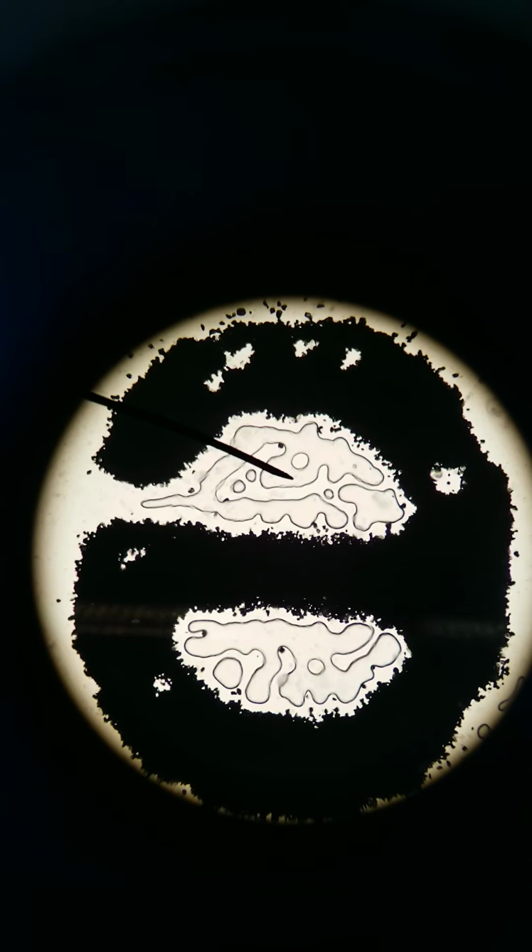To illustrate what it looks like at 400x total, I'm going to switch to the high power objective, the 40x objective. Here we are at 400x total magnification, and I'll change the focus a little bit. There we go. You can notice that it got a little bit darker. The higher the magnification that you go, the darker it gets. So you'll want to adjust the lighting a tiny bit. Play with the illumination knob, play with the diaphragm control, and I'd say that's a little brighter. Okay, that's good enough for our purposes.